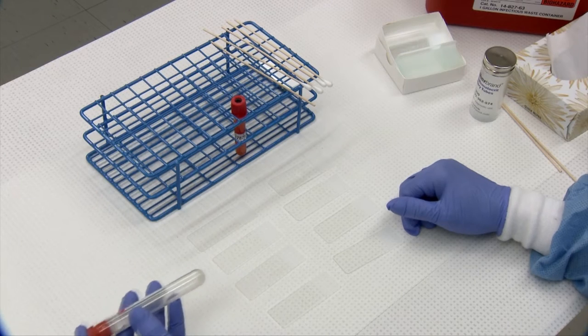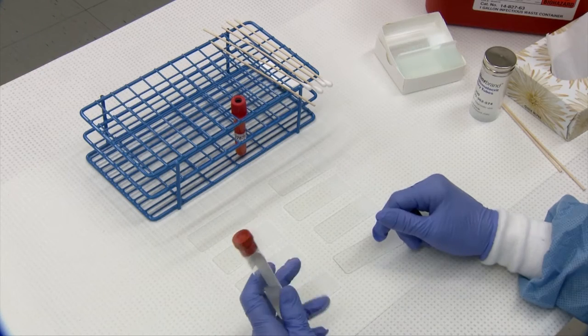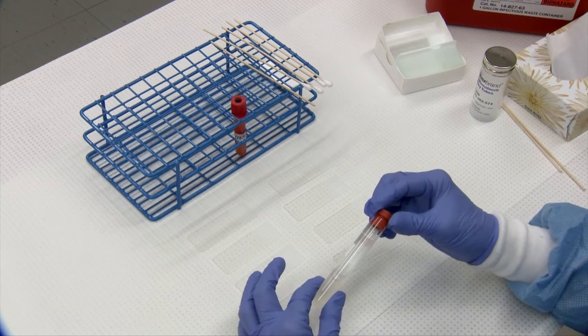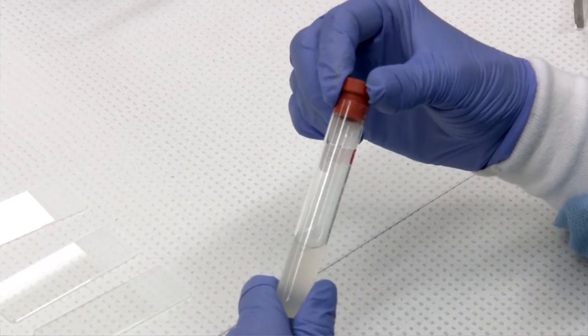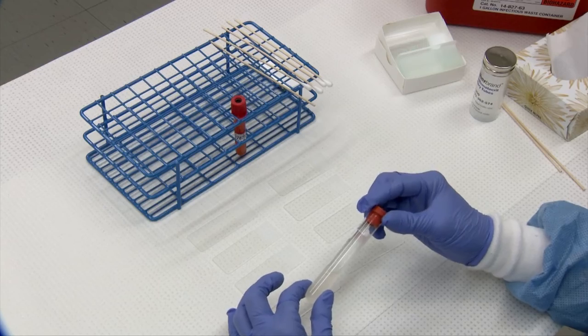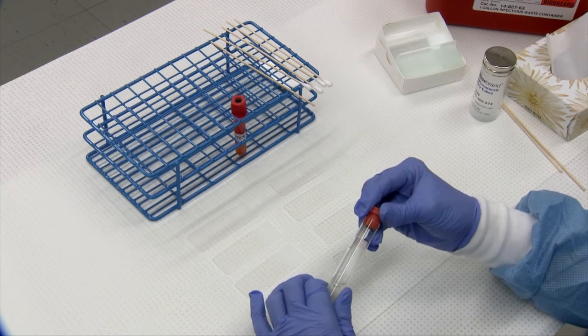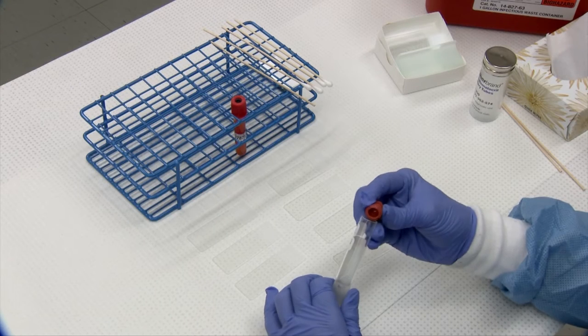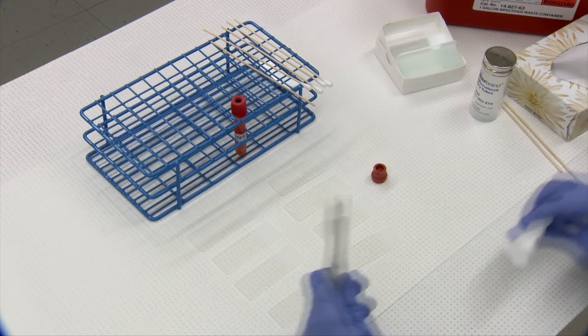I will demonstrate making of a direct, a line, and a swabbed smear from a sample that has some particulate matter in it. Whether or not it has particulate matter you want to treat them all the same, and after that I will show how to make a concentrated sample by a cytospin methodology and also explain how you can do it in your own clinic without the use of a cytospin.